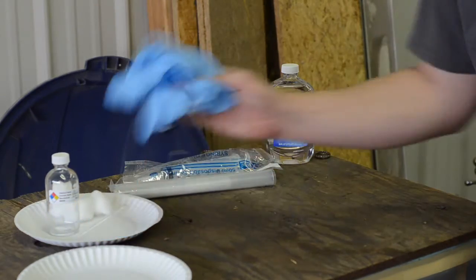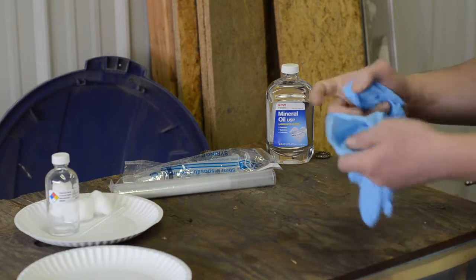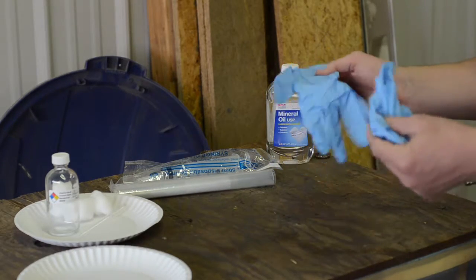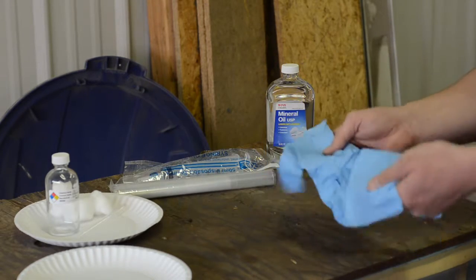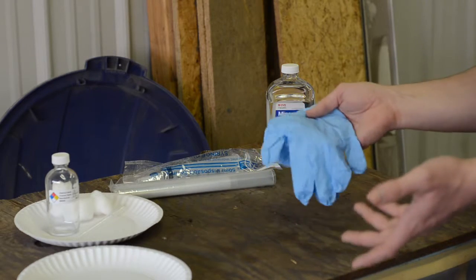Here's what I've got. Gloves. It's not supposed to hurt you with skin contact, but I don't care. I'm going to wear gloves. These are nitrile. This is the paranoid amateur's guide to mercury storage, so prepare for it to be paranoid.